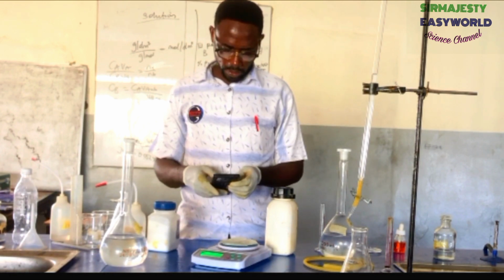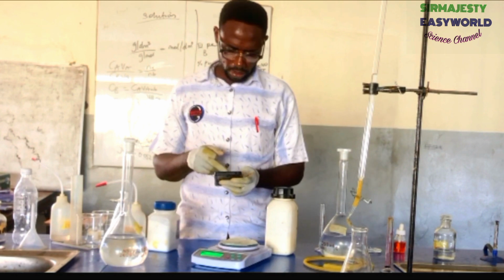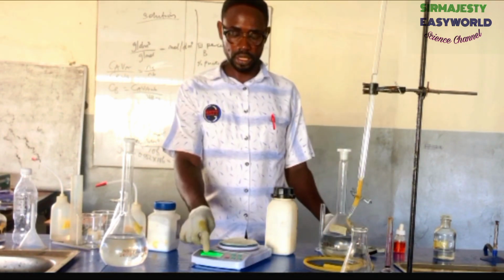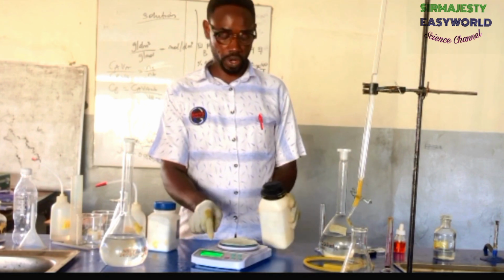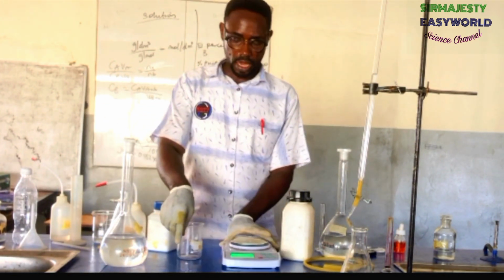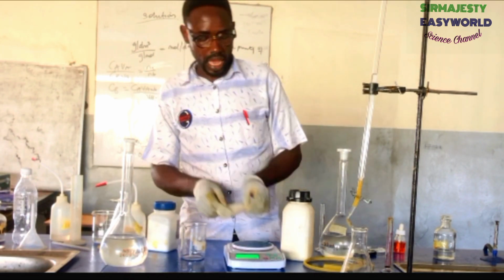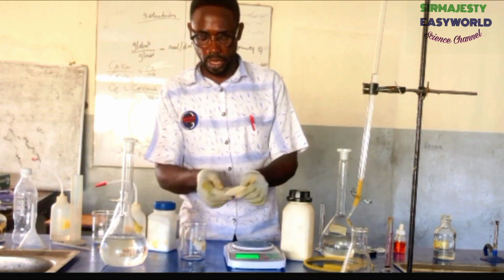5.5 plus 0.8 is 6.3. Right, okay. So you just keep adding the sodium carbonate here until this reaches 6.3. When it reaches 6.3, you bring an empty beaker like this and discard that. That 6.3 means you have measured 5.5 because the other weight was added by the filter paper.